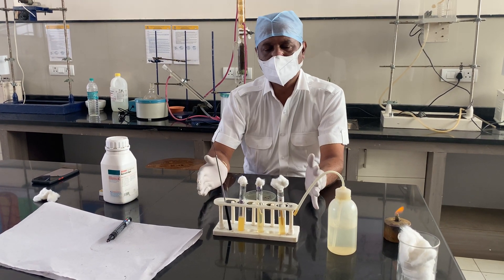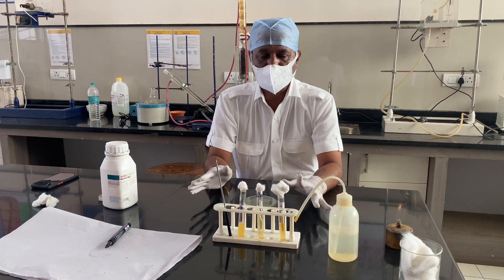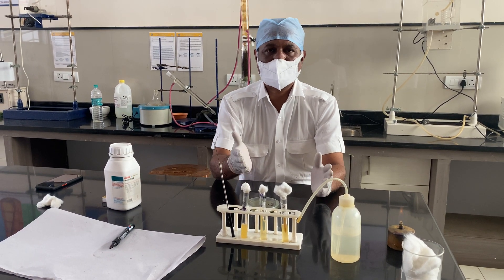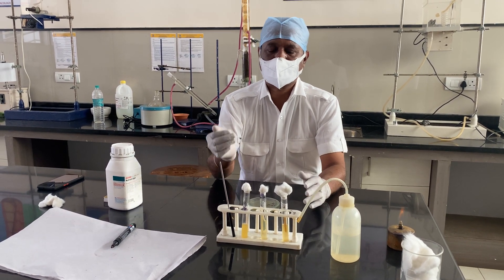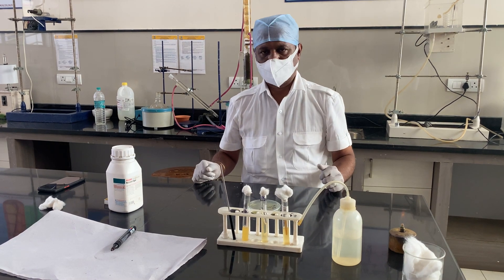This is the general demonstration of how we perform the aseptic technique. Thank you.